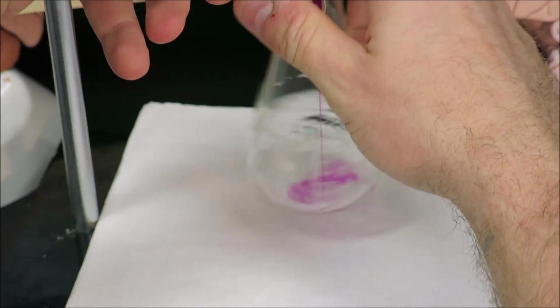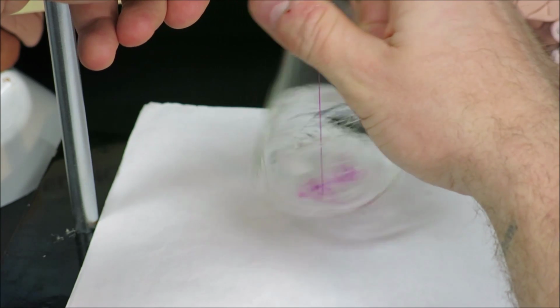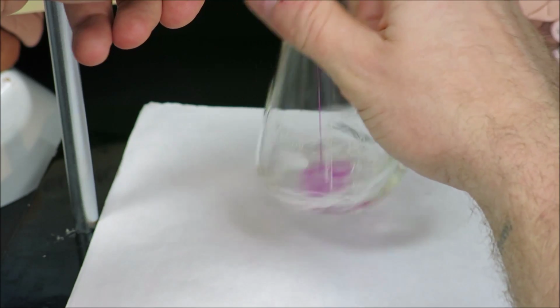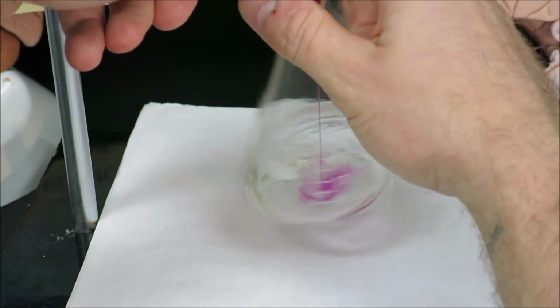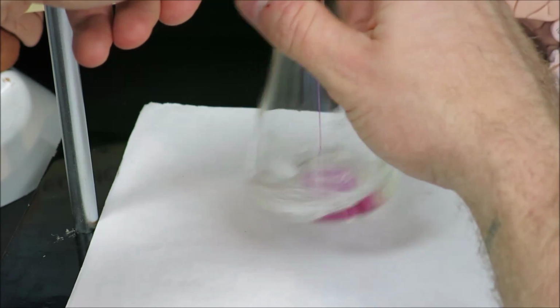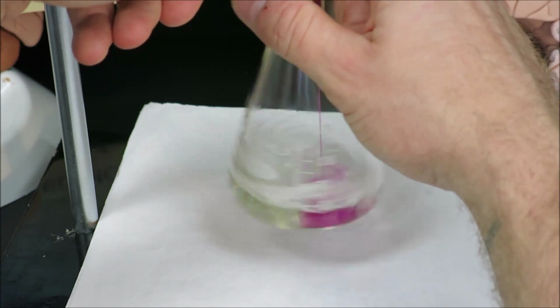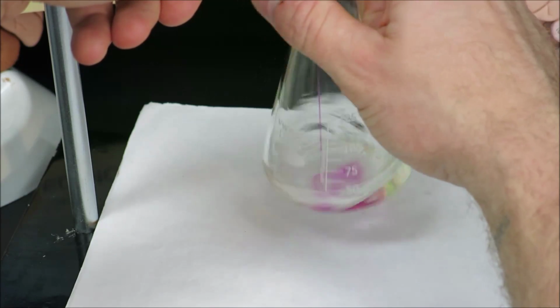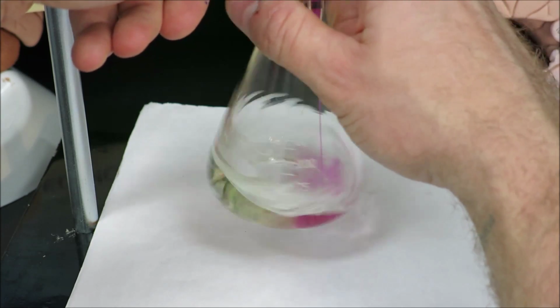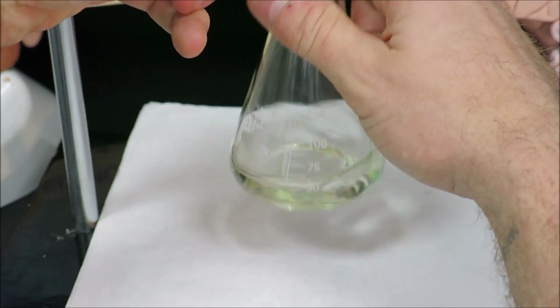Very important here to swirl, because if we don't swirl, a secondary reaction can occur where the titrant is entering into the sample, and I can't allow any other reactions than the redox reaction that I want here. So we're reaching the 10 milliliter mark here. And we're going to keep going until we get very close, to about a milliliter away. And now I can slow back down to my drip pattern.